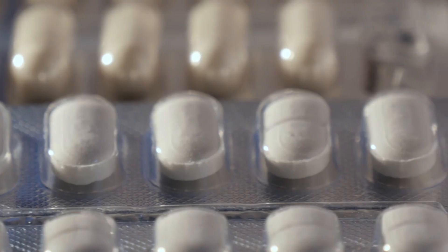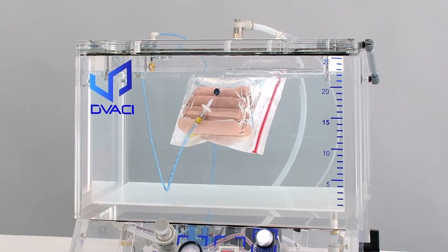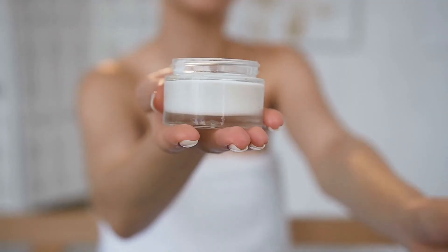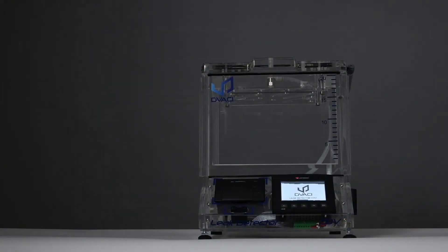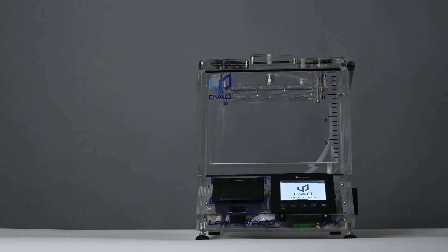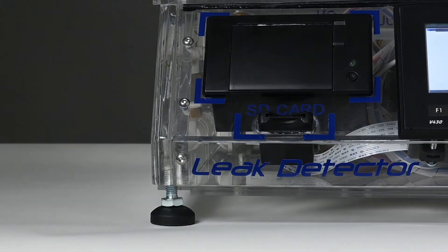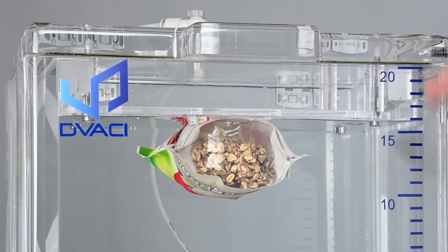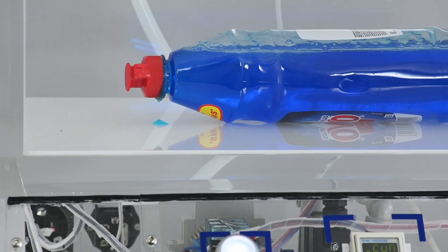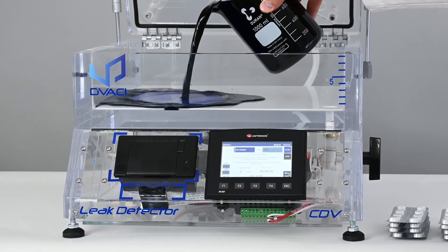The objective of leak detection tests is to ensure that products are properly sealed. Our vacuum chambers are designed to enable visual leak detection in conducting tests by immersion, dry procedure, or using blue dye.